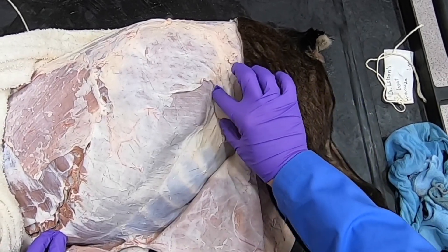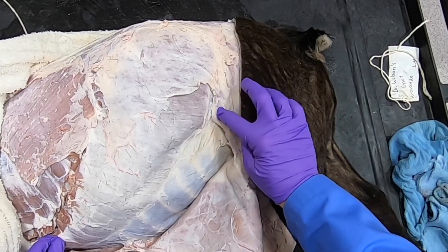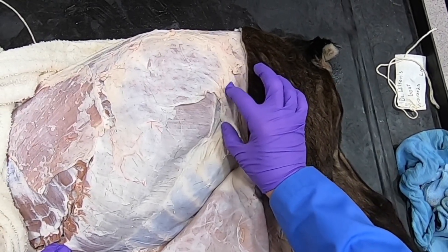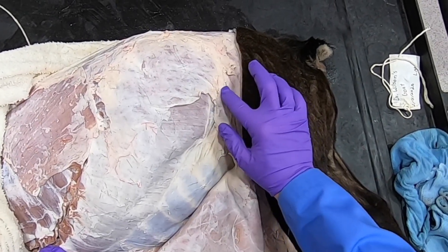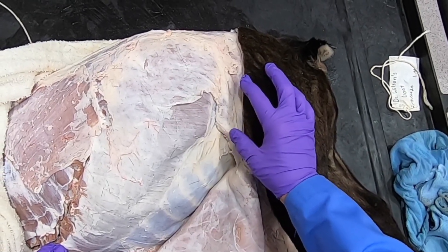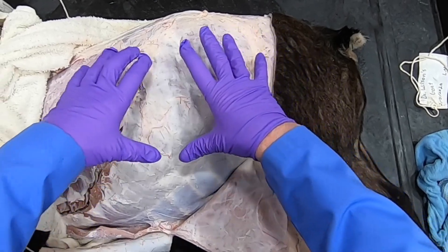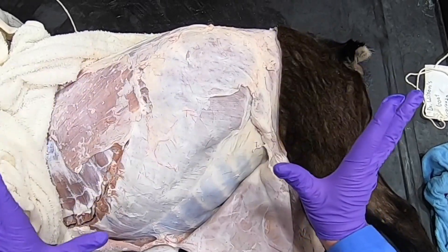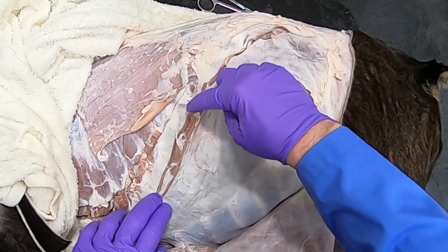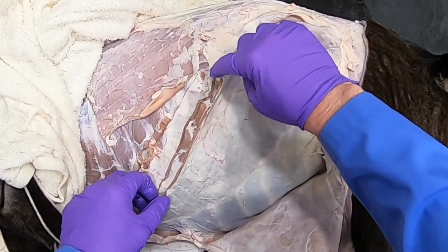In the fold of the flank we can see a nice large lymph node. This lymph node is the sub-iliac lymph node, sometimes called the pre-femoral lymph node. Now we're going to open this up by cutting along the origin of the external abdominal oblique and reflecting it.